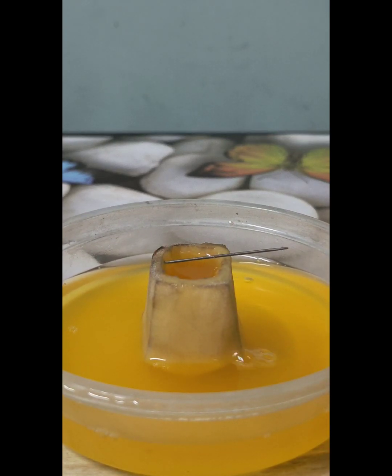Now, if this is kept for some 10 minutes or higher, water molecules will tend to move out from the hollow of the potato cube into the external environment, resulting in exoosmosis, and that will result in the lowering of the level of the solution inside the hollow of the potato cube, and the cells of the potato cube will shrink.